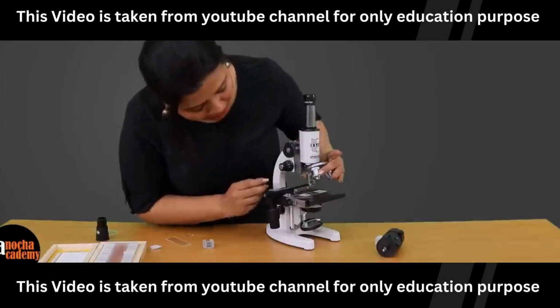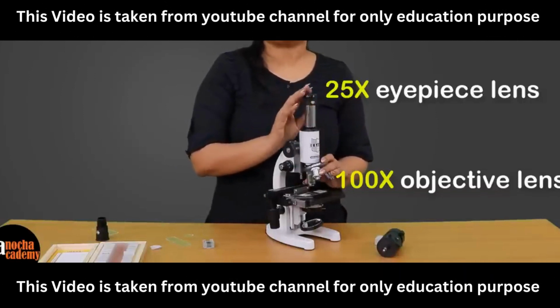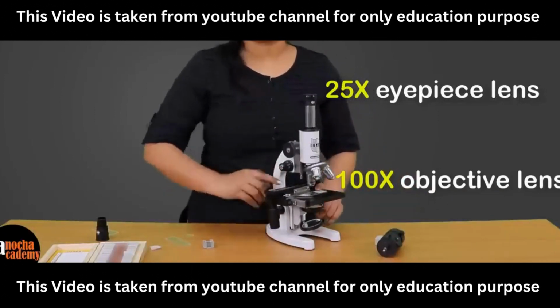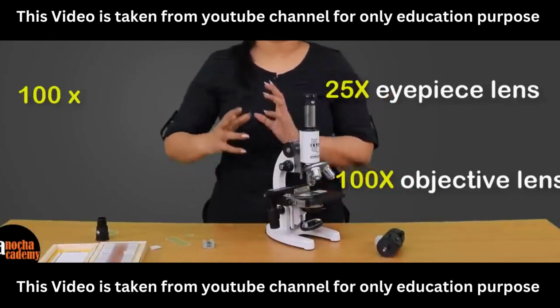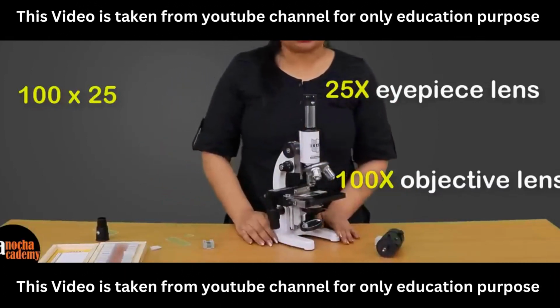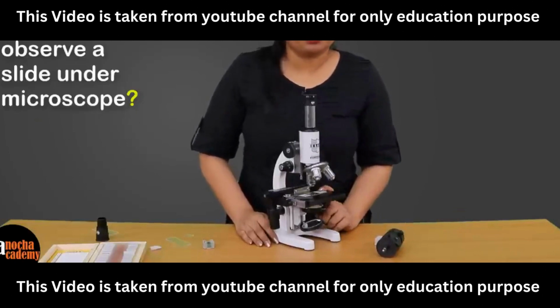Now at this point of time, I am using 100x for the objective lens and 25x for the eyepiece lens. So if I am using 100x and 25x, then first the specimen is magnified 100 times, and then that 100 times magnified image is magnified another 25 times. So you are getting overall a magnification of 2500 times of the actual size of the specimen that you see here. So how do we observe it?